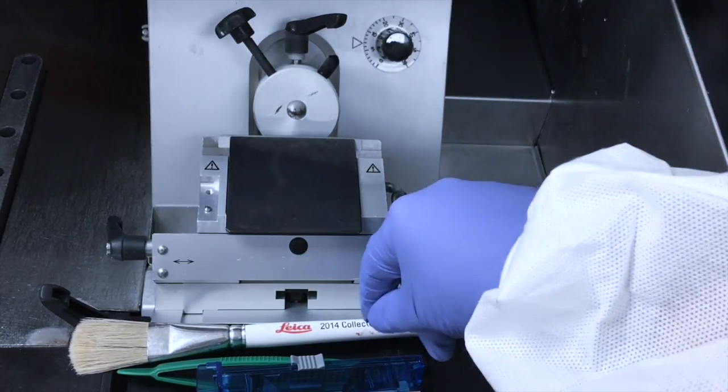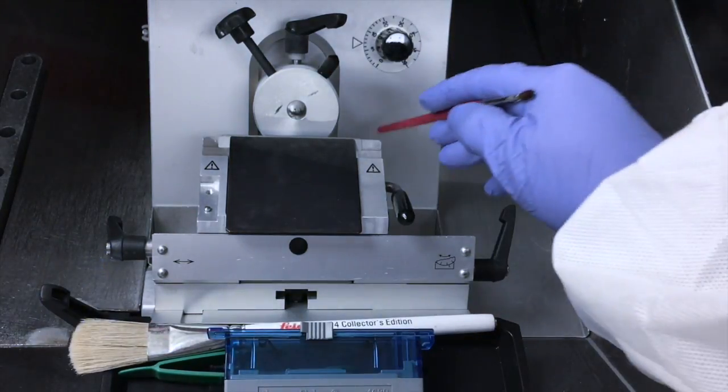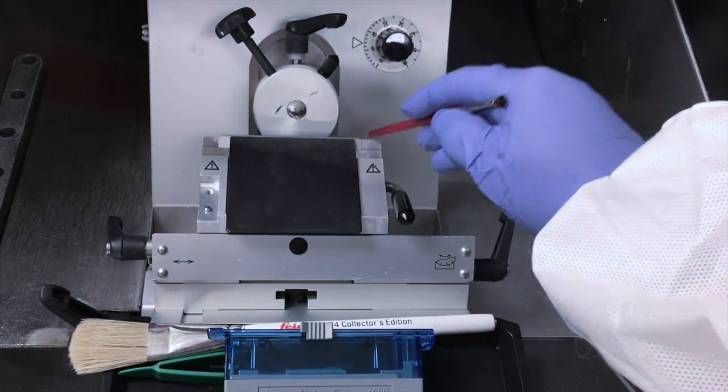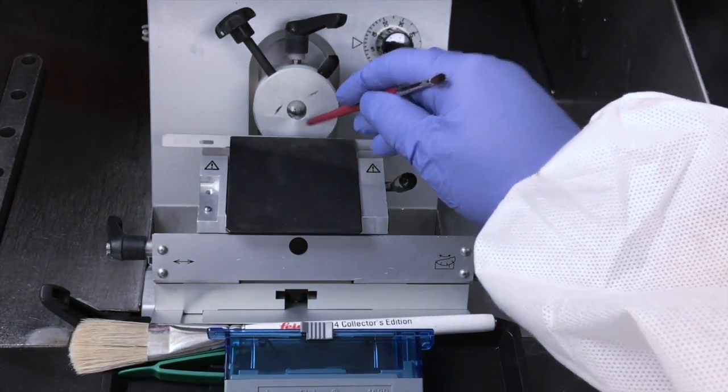At times the clamping plate will stick, so slightly tap blade plate corner to loosen. Then use the tip of a wooden brush handle to slide blade from behind plate.